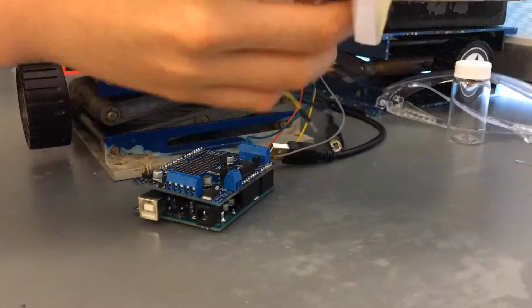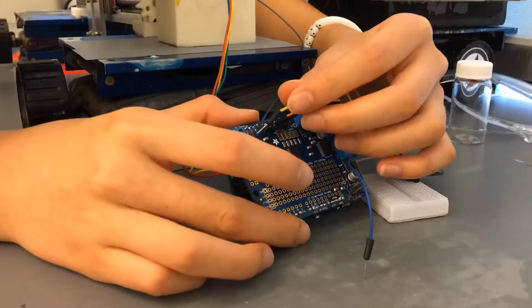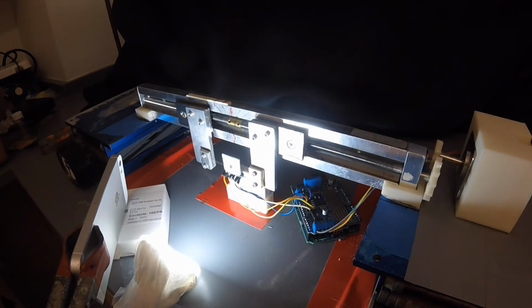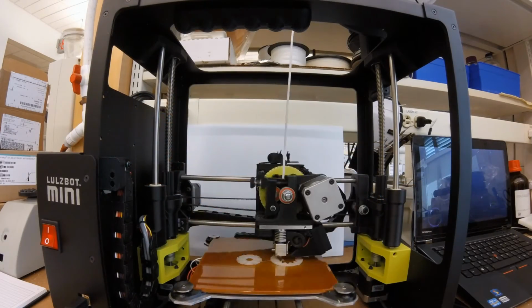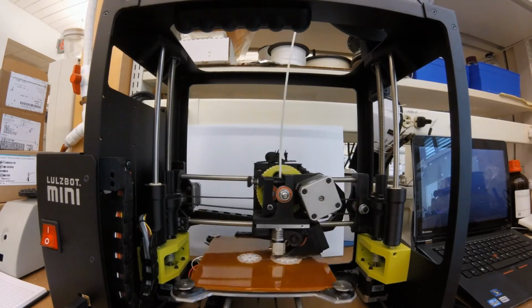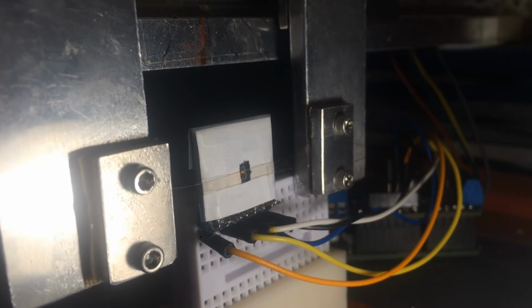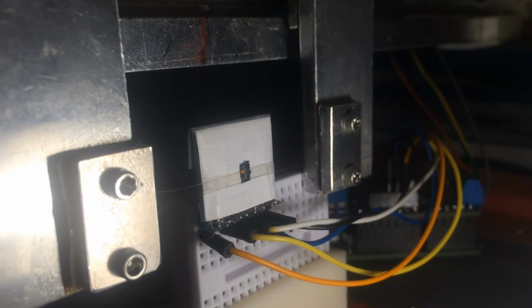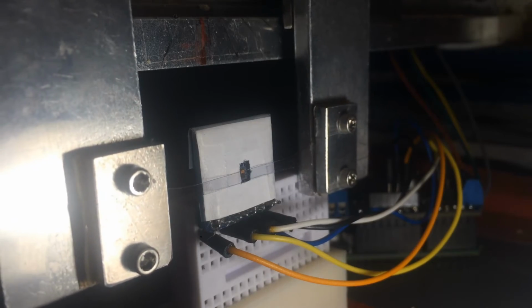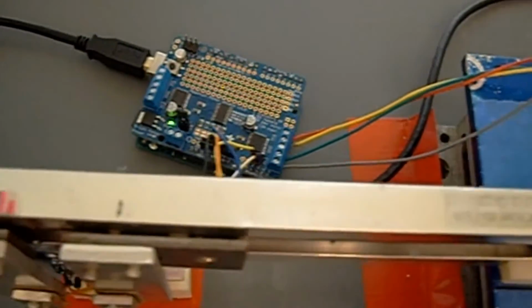The hardware that we're using includes an Arduino Uno board, an RGB sensor, and a stepper motor. We're also using this device to slowly stretch our film. To connect it to the stepper motor, we have 3D printed the gears along with several other parts in our setup that hold the hardware pieces in place. The RGB sensor is placed behind the polymer film to monitor any color change within the film. In order to provide enough light that reaches the sensor, a white LED light has been placed in front of the film. So here's our whole setup, and now let's look at the code.